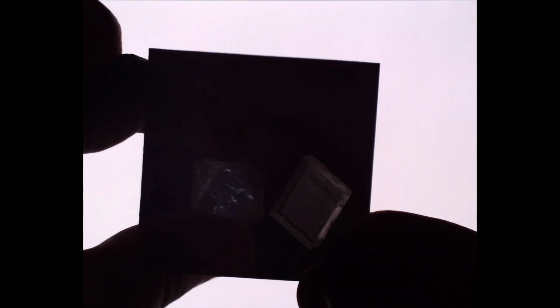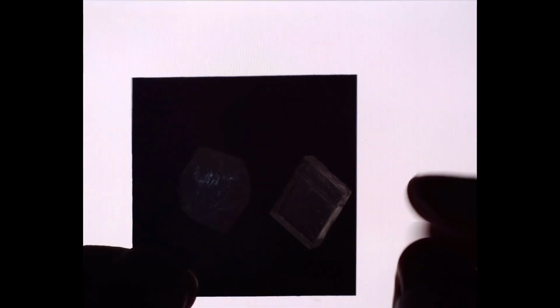So now that we've figured out what's going on with our calcite crystal, let's change our focus over to our fluorite crystal, and we can determine whether or not our fluorite is isotropic or anisotropic by rotating it. So as we rotate the fluorite with crossed polarizers, we can see that not much of anything is happening. There are some cleavage traces and also inclusions that are lighting up in our fluorite, but overall, the whole crystal is remaining extinct as we rotate it. You can see the difference by comparing the fluorite as I rotate it to the calcite while it's transmitting light.